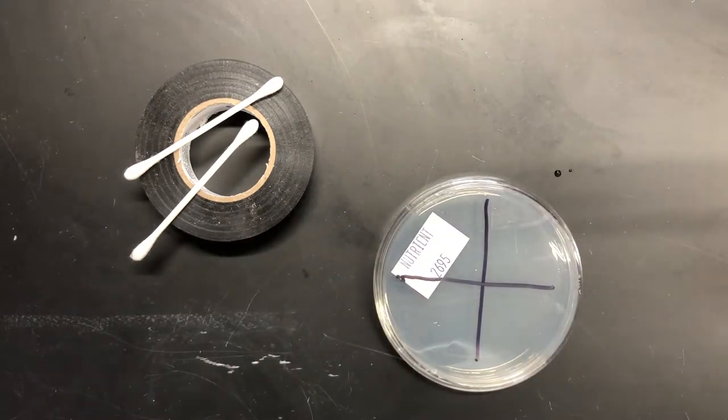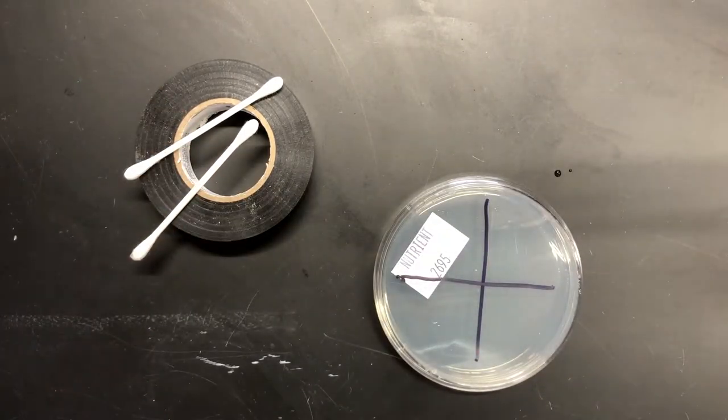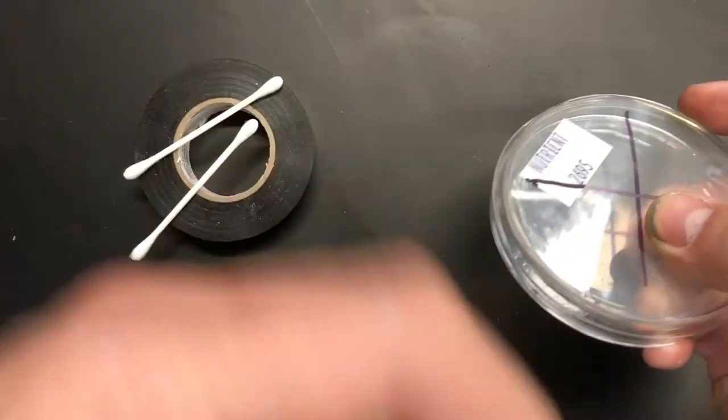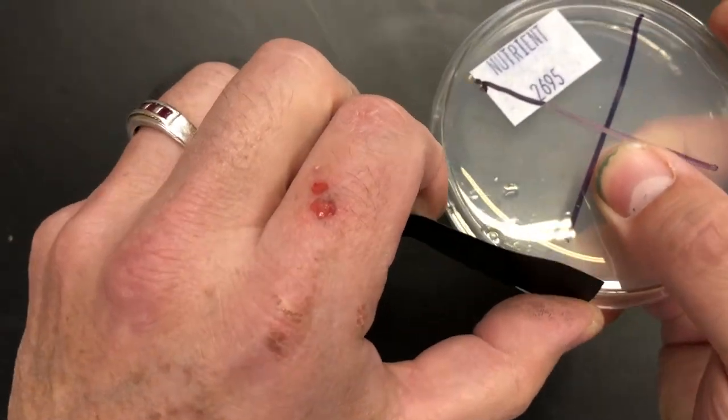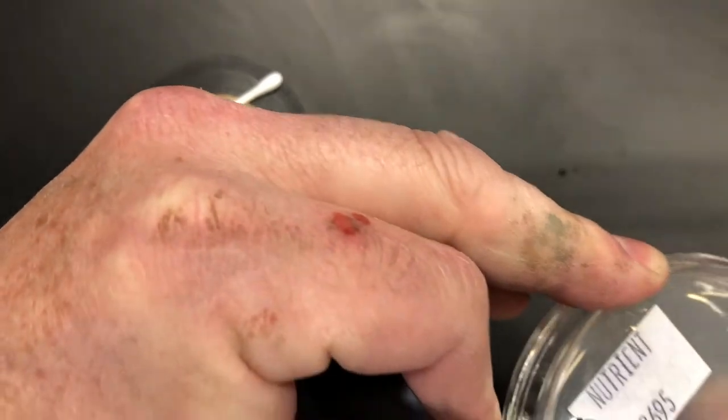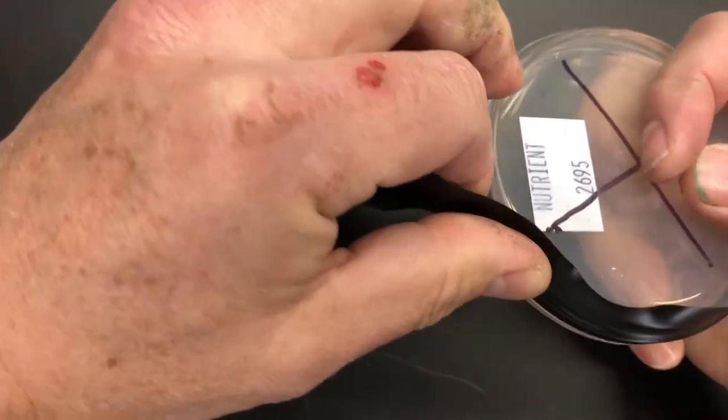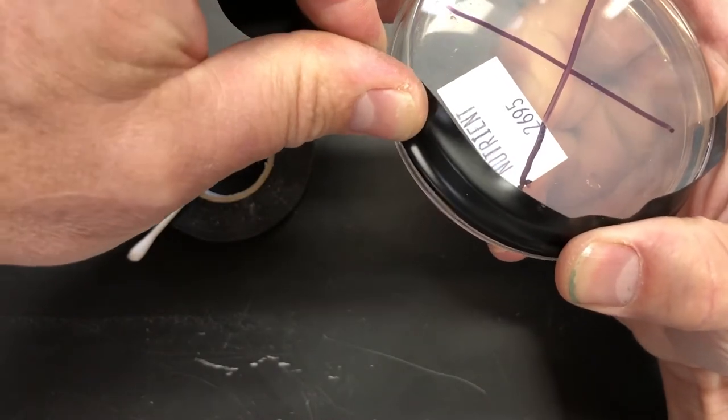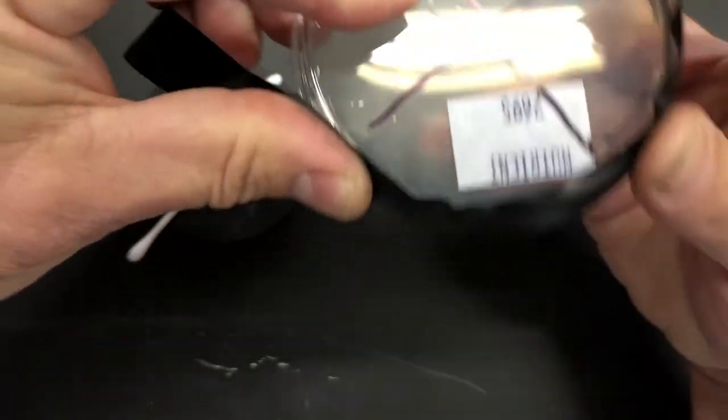Which is why Science Materials Center provides you with electrical tape. Electrical tape will stretch as you pull on it. So this is about a foot of electrical tape that I've cut already, and we're gonna make sure that we get it both on the larger plate and the smaller plate, and we're gonna stretch that as we go so that we don't get any wrinkles. We're gonna keep it tight. I'm gonna make sure that we've got good support on the part that we've already got stuck down so that we don't pull it off. We're gonna stretch that around the whole outside ring.